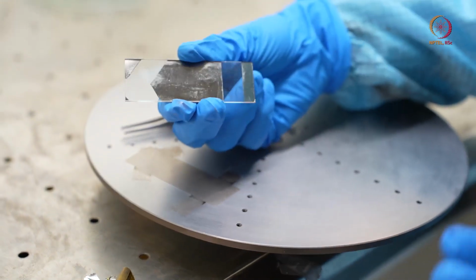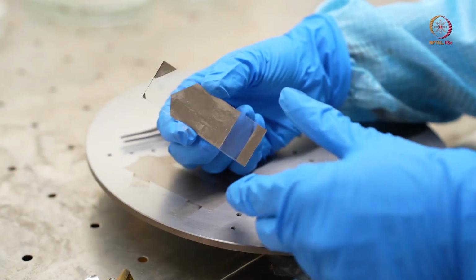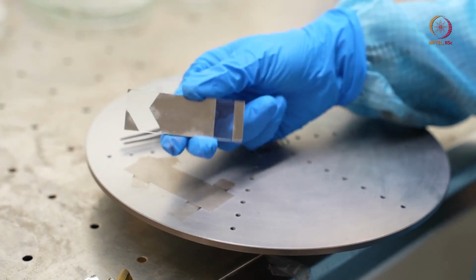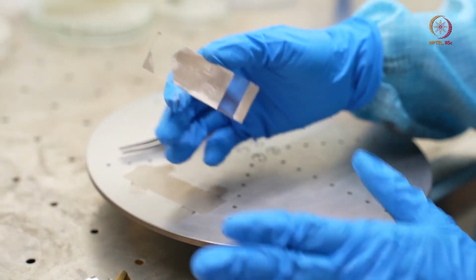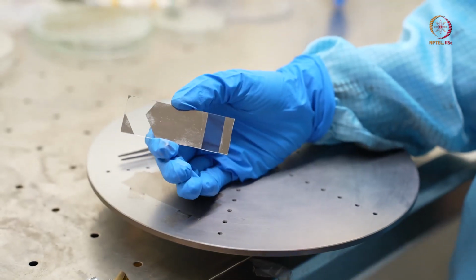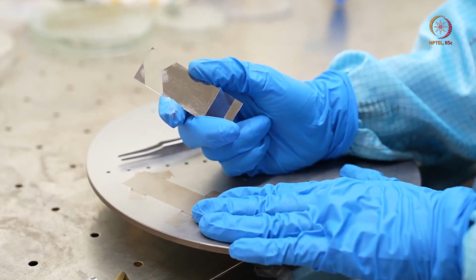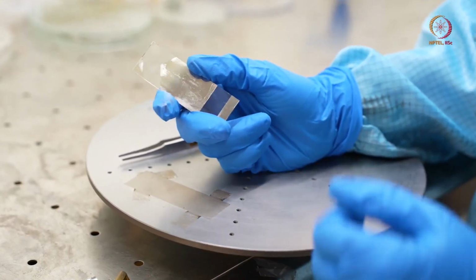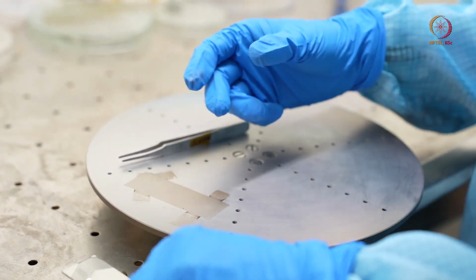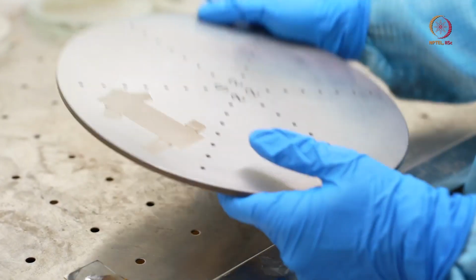So this type of depositions you can do, and as the Kapton tape was pasted, we have some pattern based on that. So this is all about the deposition. Now, switching off the tool, that we will also show after this. Before that we have to put this chuck inside the chamber, then we will discuss the other things. Let us keep it here only on the wet bench, and let us go back to the tool again.